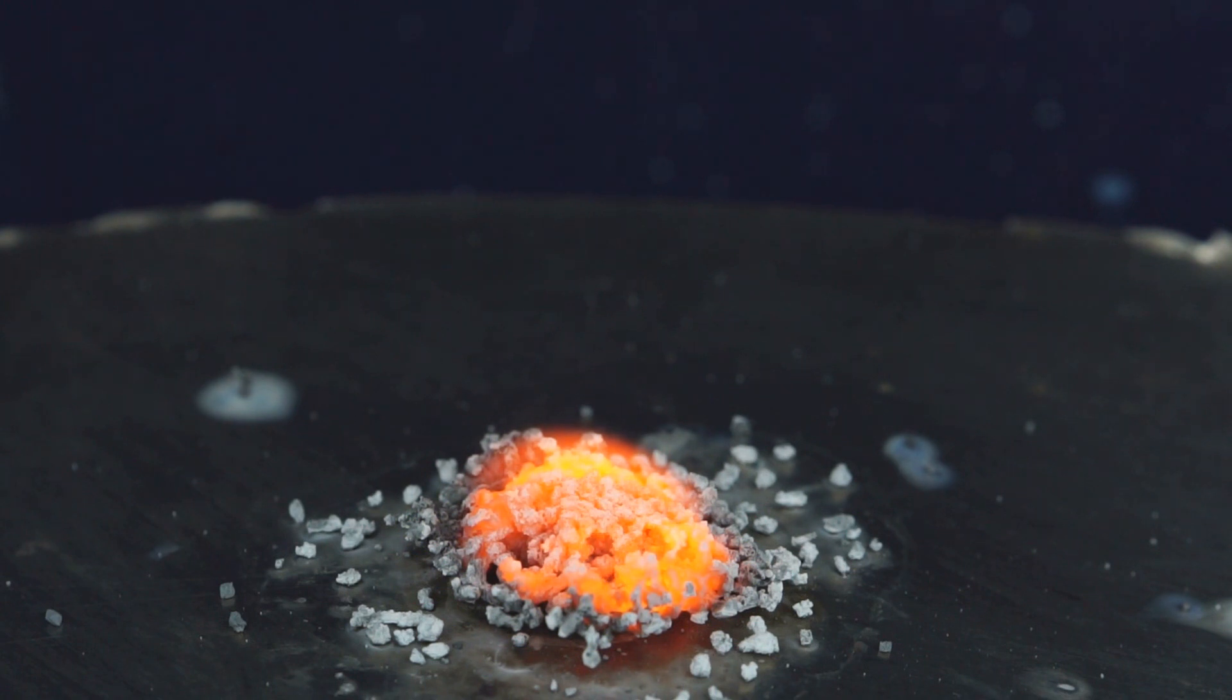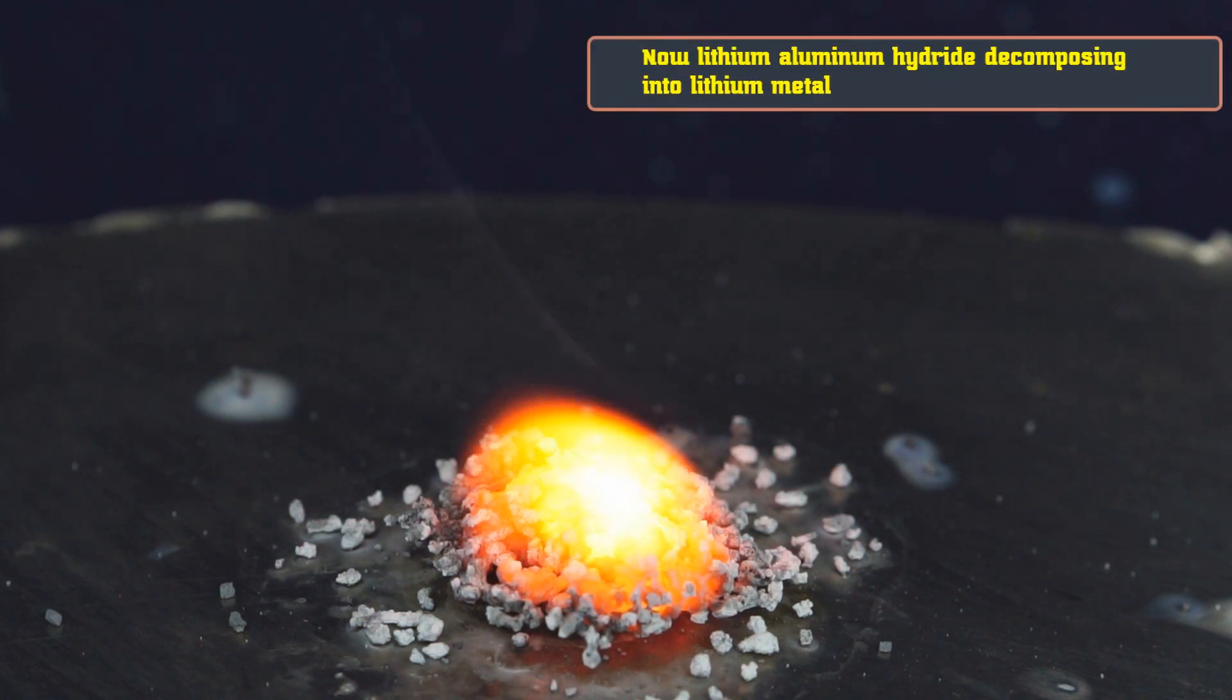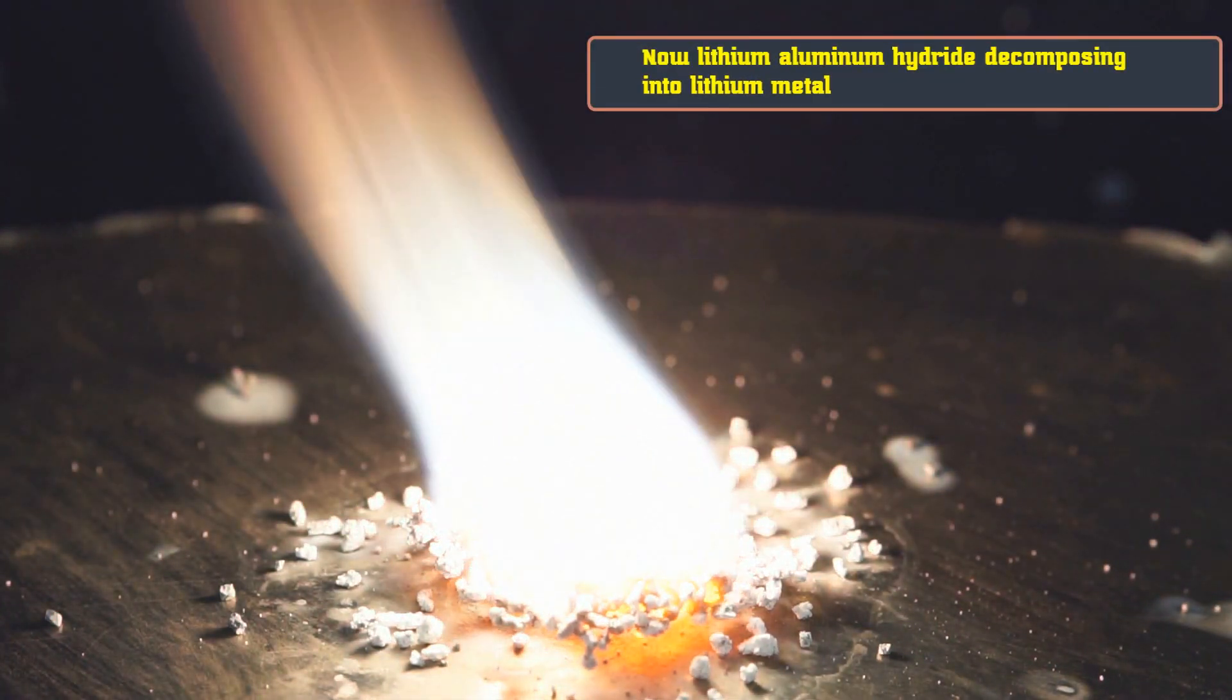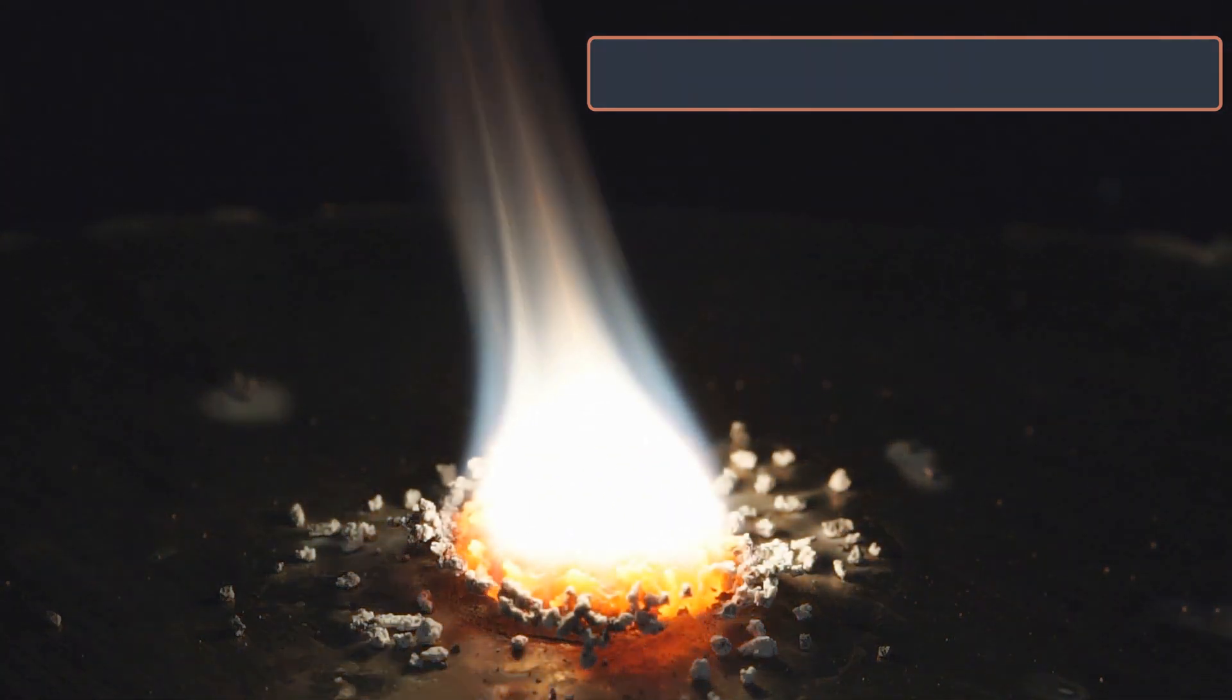When it burns, it decomposes into metallic lithium which flashes with a dazzling flame at the finish of the reaction.